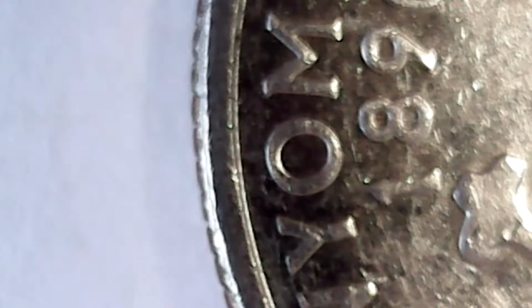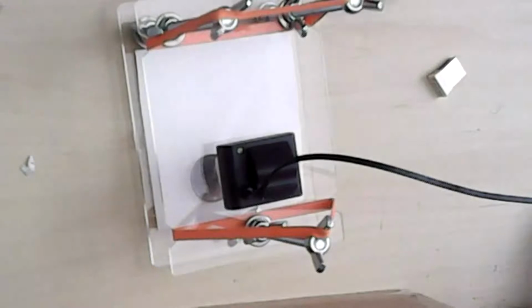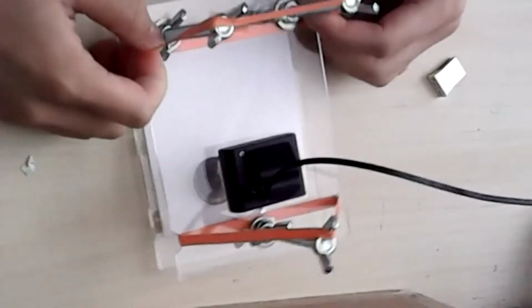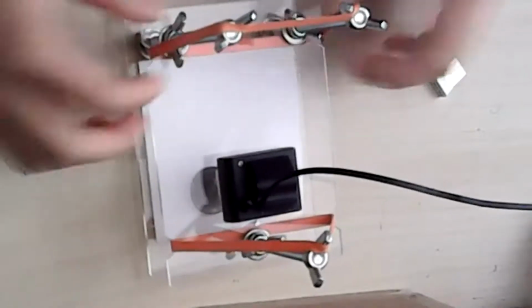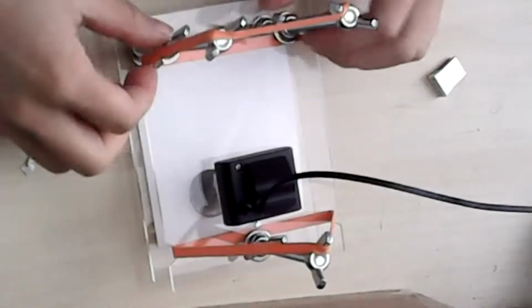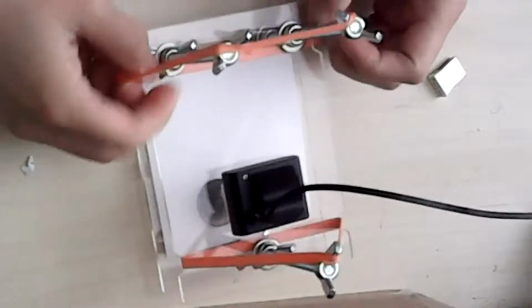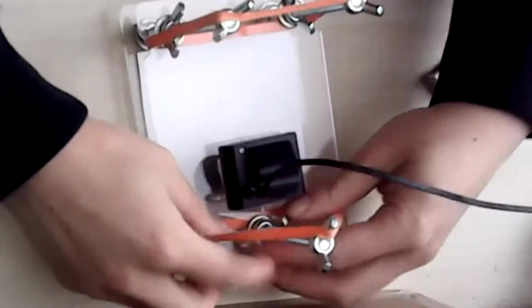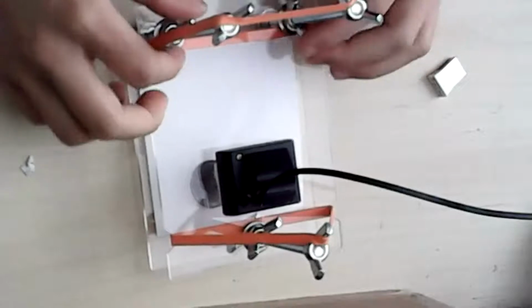Can you show us how we would make adjustments if we needed to? Oh yes, I can. Let me switch to my other camera. Too many cameras. So the way you would make adjustments is to turn the wing nuts, either unscrew them or screw them in. If you want the stage to be lower, then you would turn them all clockwise and make sure to turn all 3 so it's not super weird and tilted. That's what I would do. Turn 3, and then a little bit, and it'll be closer. Yeah, that's it.